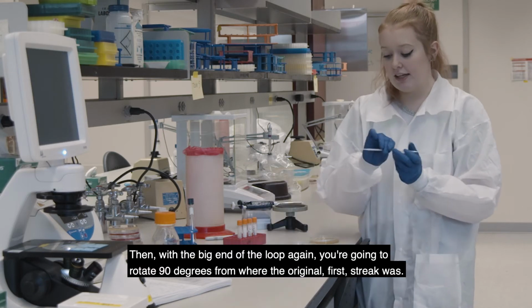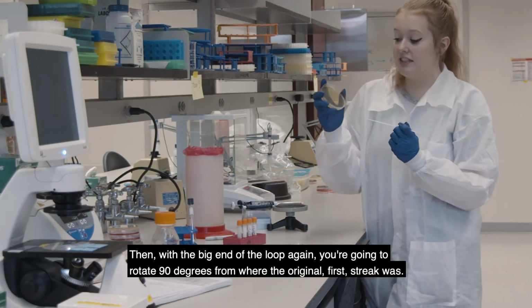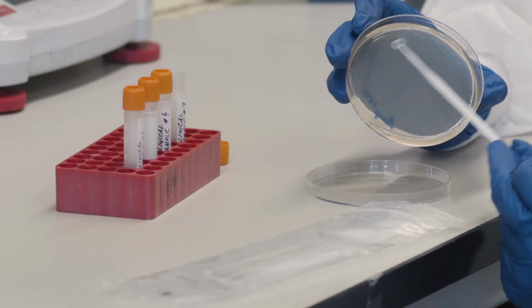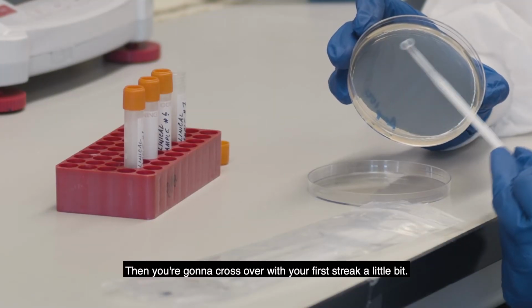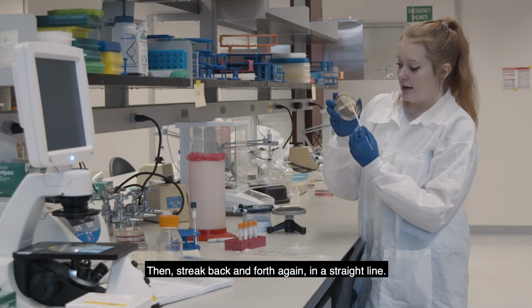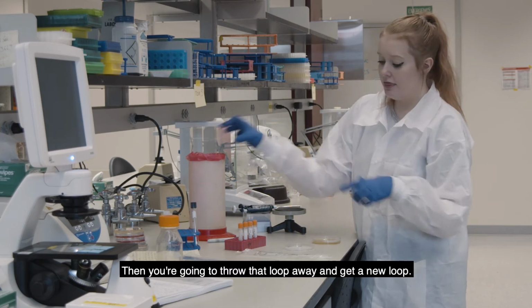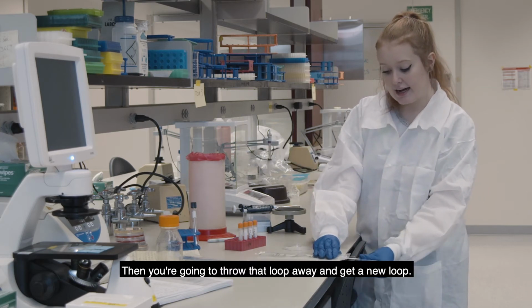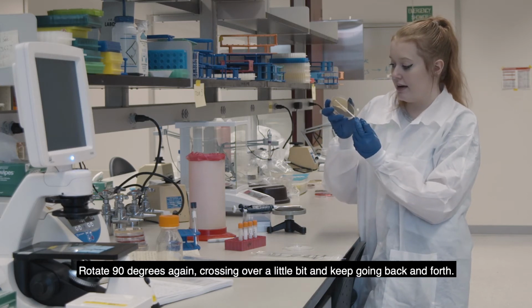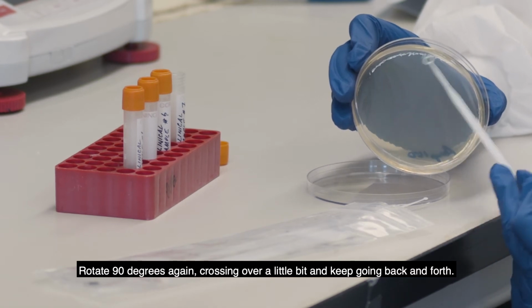And then with the big end of the loop again, you're going to rotate 90 degrees from where the original first streak was. Then you're going to cross over with your first streak a little bit and then streak back and forth again in a straight line. Then you're going to throw that loop away and get a new loop. Rotate 90 degrees again, crossing over a little bit, and then just keep going back and forth.